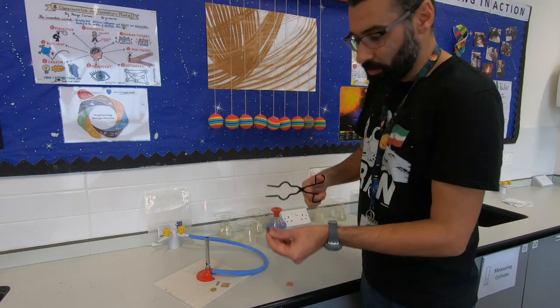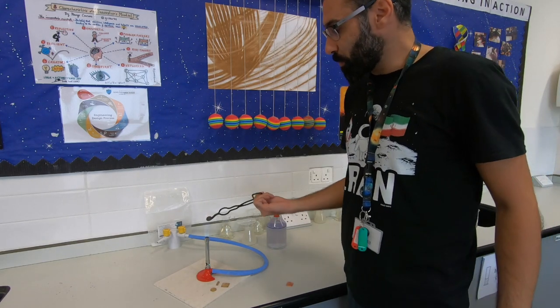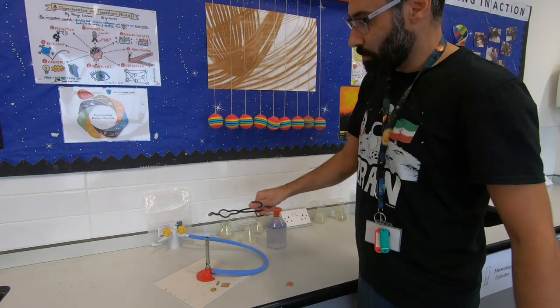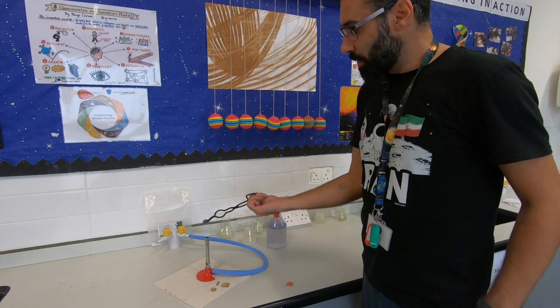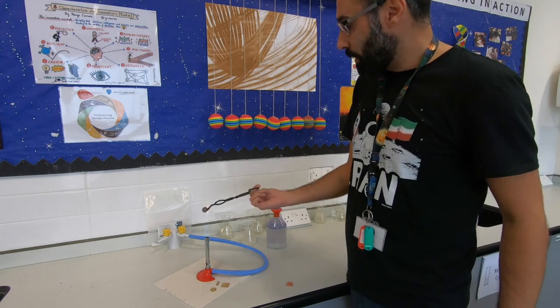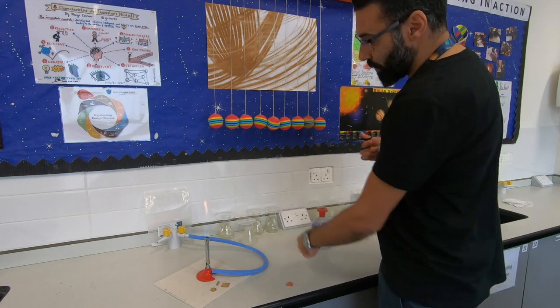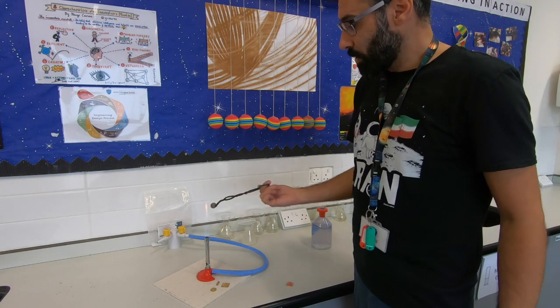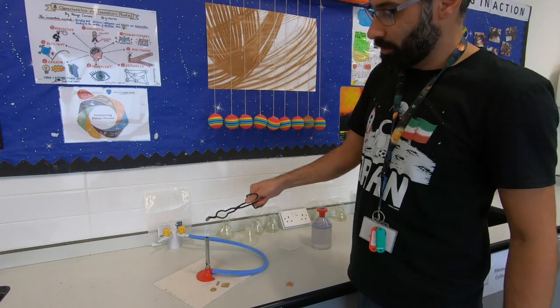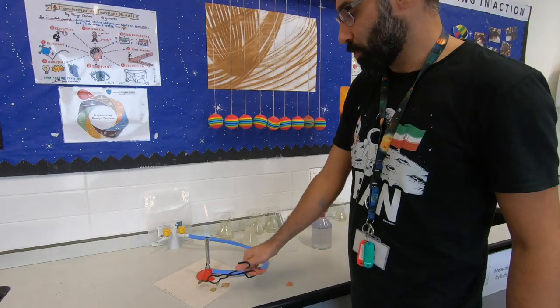The copper coin that wasn't clean got some dark silvery color — let's see what happens when we heat it up. The oscillating reaction is completely gone clear, by the way. The hot ice that I used earlier I've heated up again and turned it back to liquid — a highly concentrated solution. Gently pour it back inside this flask and you can use it again.